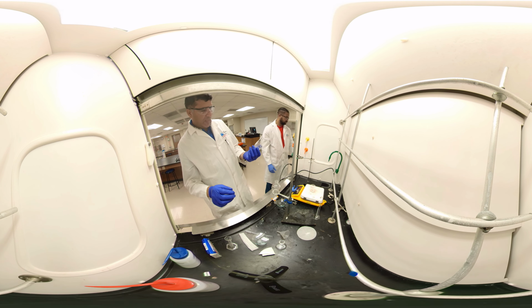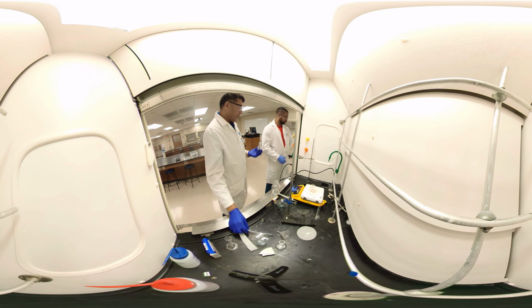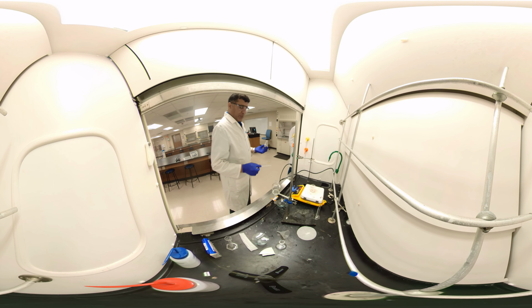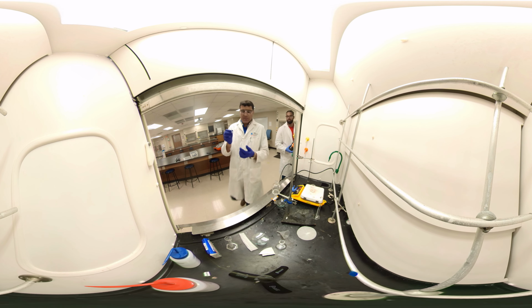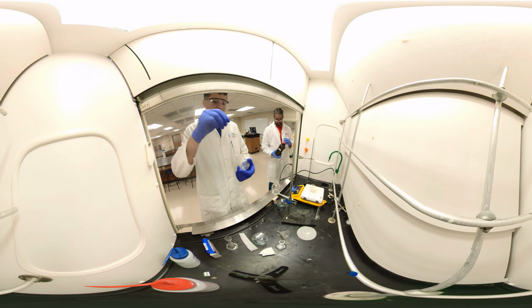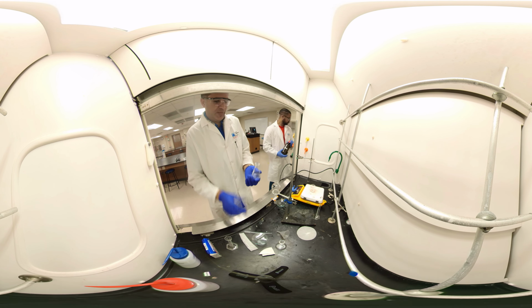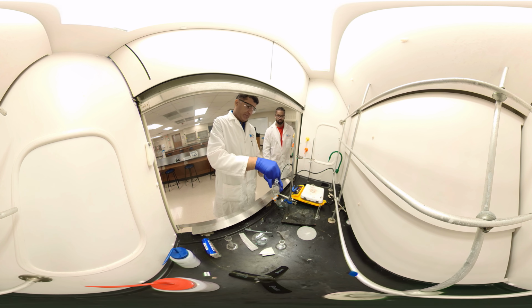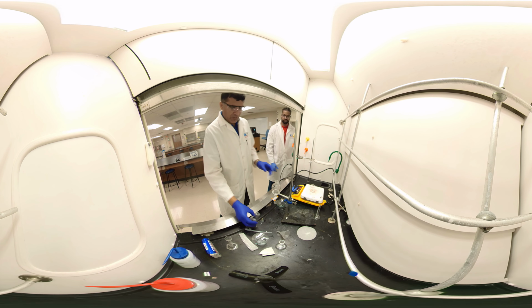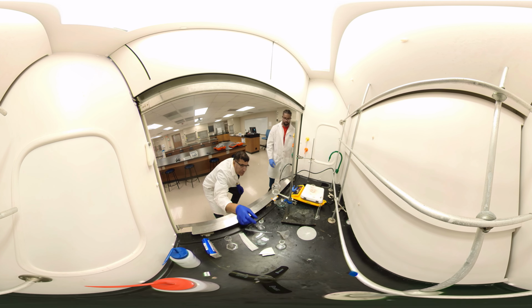We can use a few milliliters of dichloromethane just to make sure we transfer everything. So I use a little bit of dichloromethane to transfer everything there. Maybe something left there, okay? I see some solid, but that's part of there. All right. We have two components there.